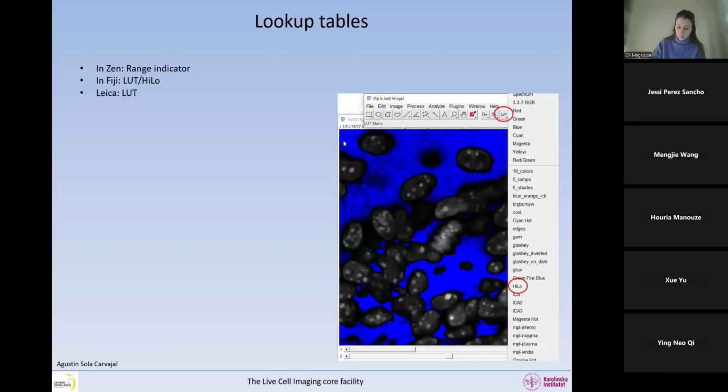So here are the lookup tables in Fiji. There is a nice little button here, and then you can change whatever you want. In Zen, it's called the range indicator. In Leica, it's called LUT. In Nikon, it's also called LUT.